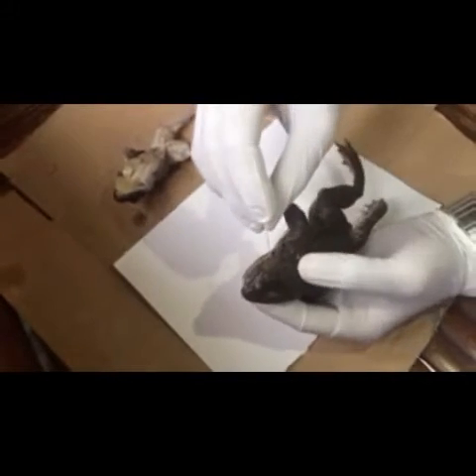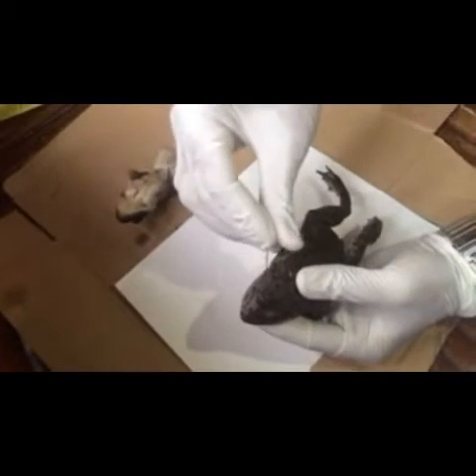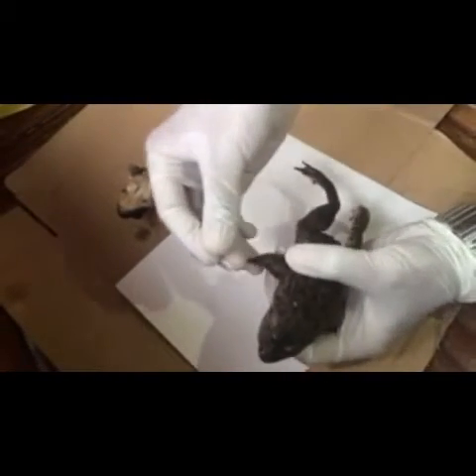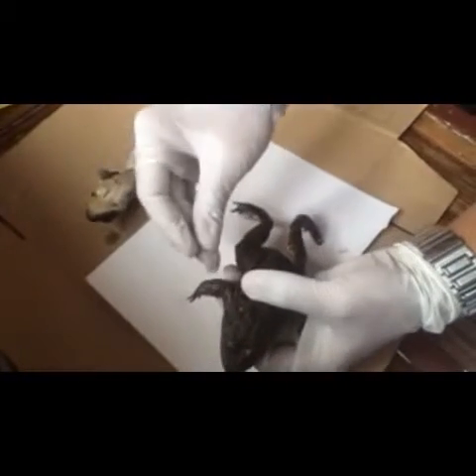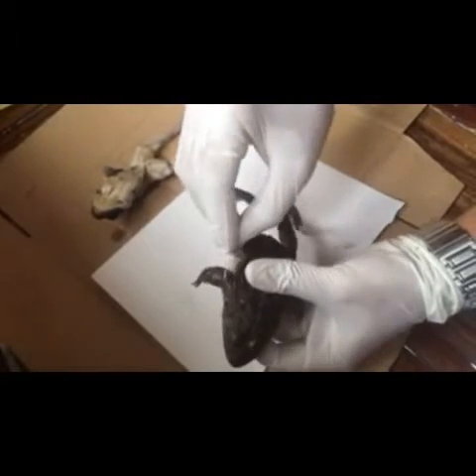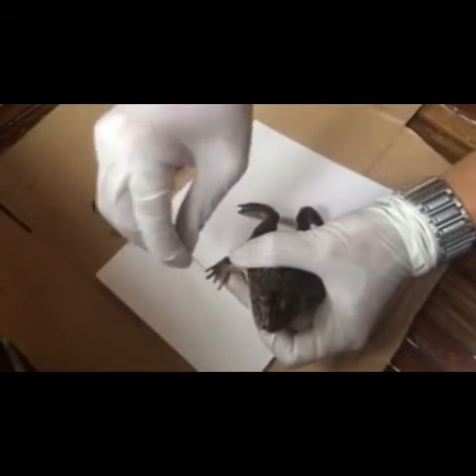And then this is the tympanic membrane. Then we will go to the upper forearm. This is the forearm, and then this is the arm, and then digits of fingers.